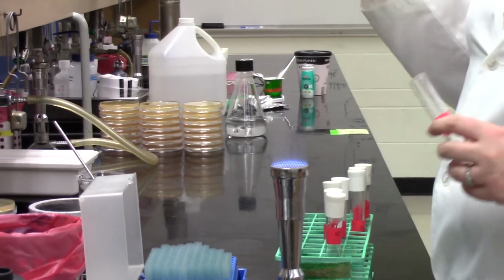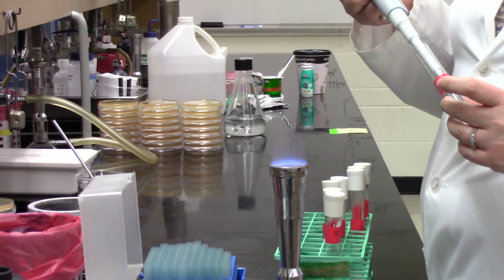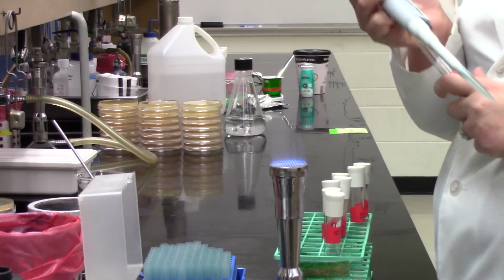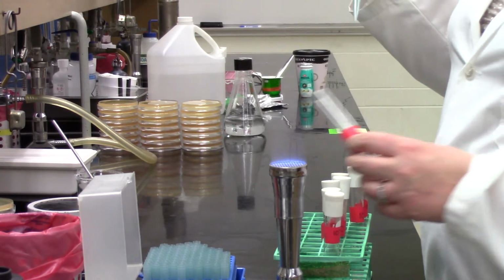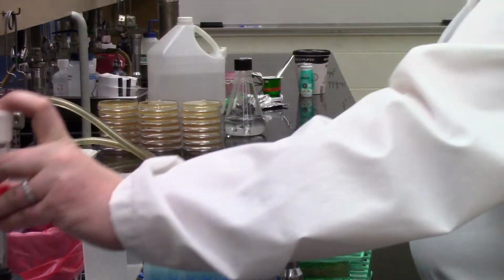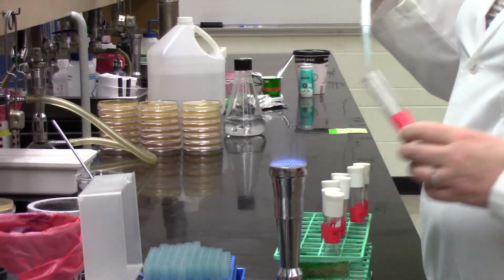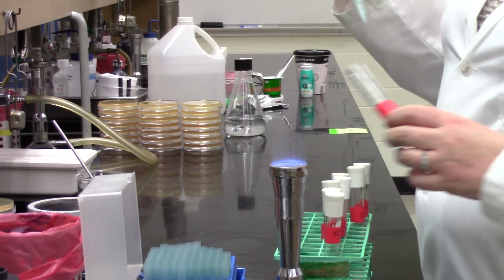And you can see what Sabrina's just done is she's moved some of the tubes that she knows she's already done, and as she goes forward, she'll just put her tube that she's completed, as she's doing right now, down one row over on the rack. And that is a really useful thing to do when you're working in the lab at any time, but especially when you're doing dilution series, to just have a way of knowing by the placement in that rack that yes, I have added to that tube. And then if you get distracted, you know, coming back to your test tube rack, exactly where you are in your dilution series.